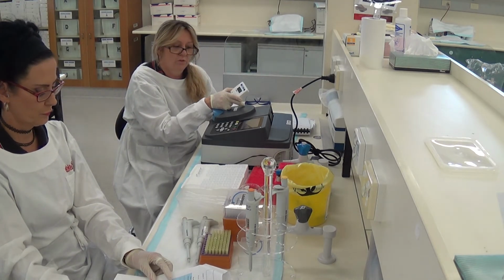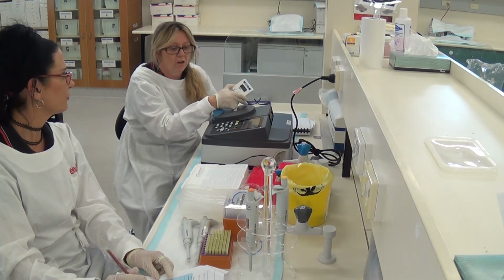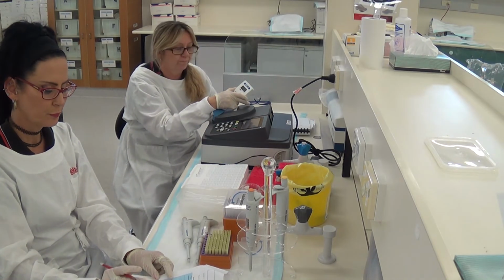So now we're up to the 150-second mark, is that correct? Correct. All right, so we're only going to time this for 3 minutes.